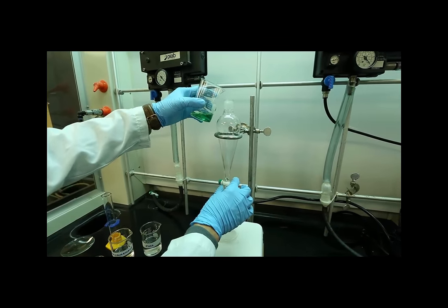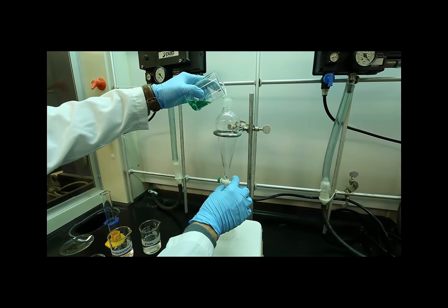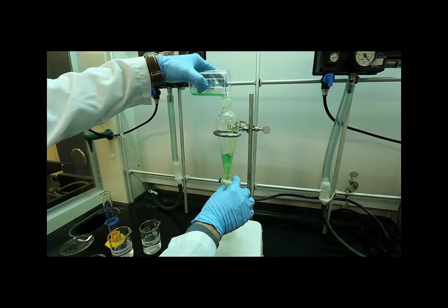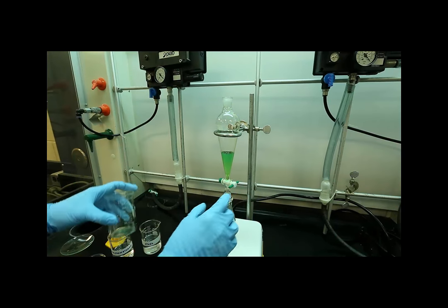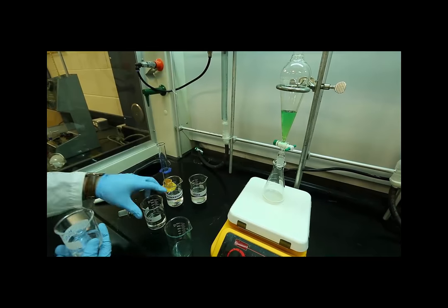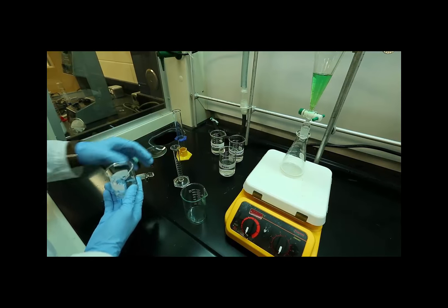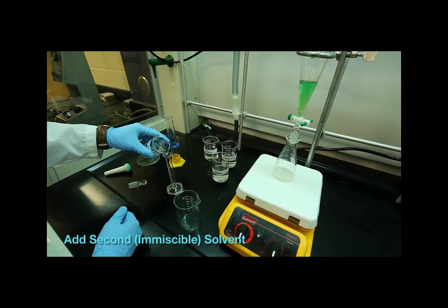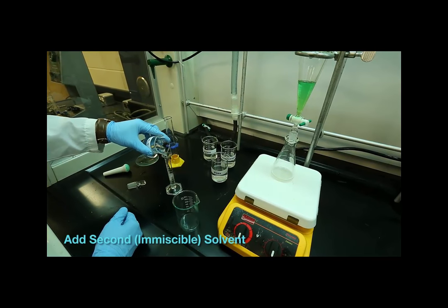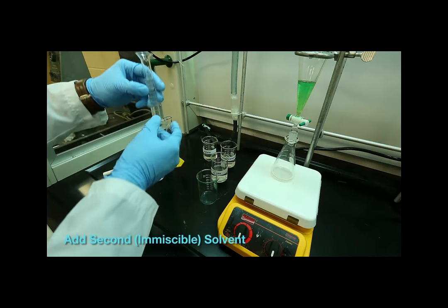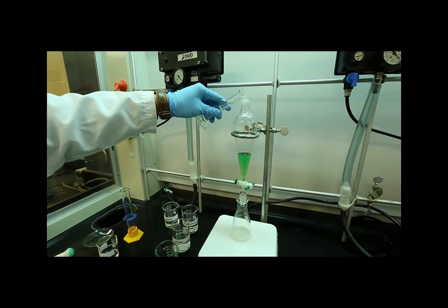Make sure the stopcock is closed. Pour in solution to be washed into the funnel. Add washing solvent, be sure not to exceed three quarters of the funnel's volume.